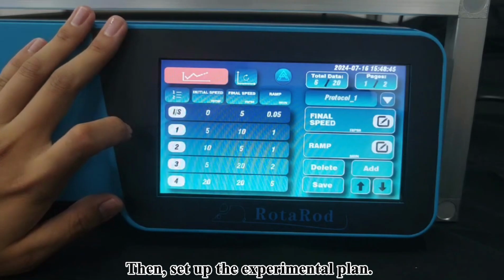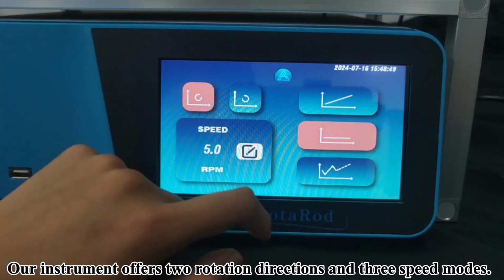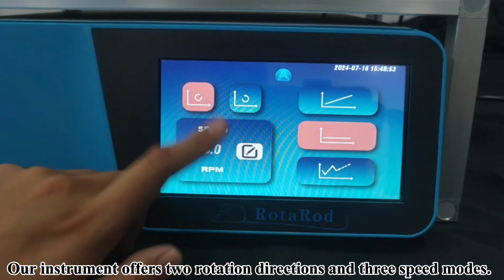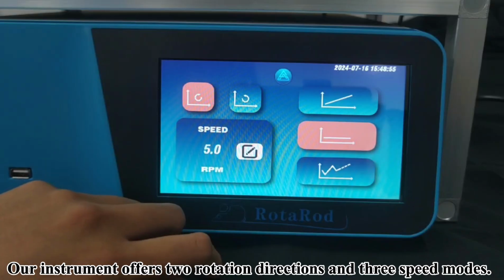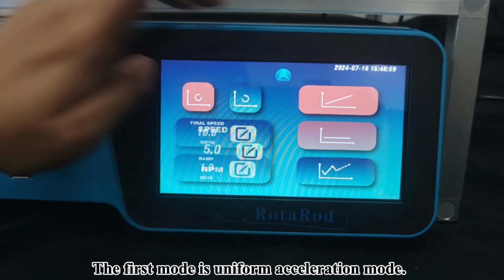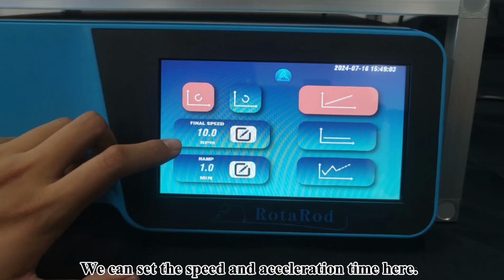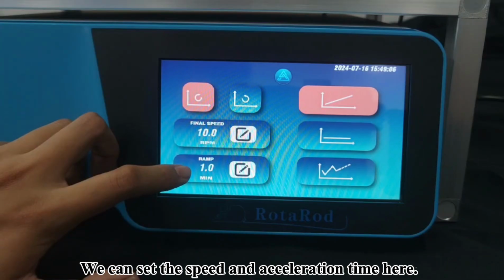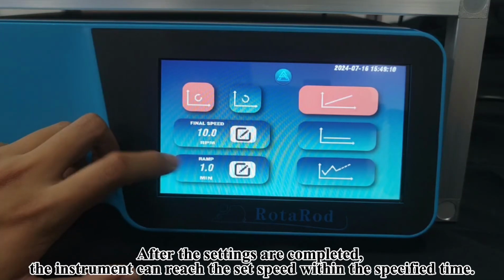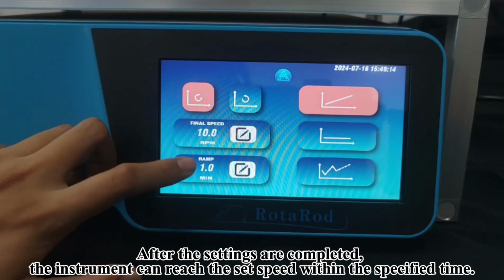Then, set up the experimental plan. Our instrument offers 2 rotation directions and 3 speed modes. The first mode is Uniform Acceleration mode. We can set the speed and acceleration time here. After the settings are completed, the instrument can reach the set speed within the specified time.